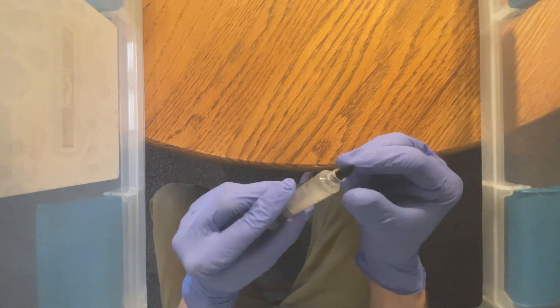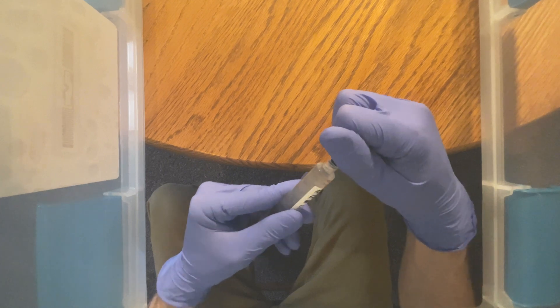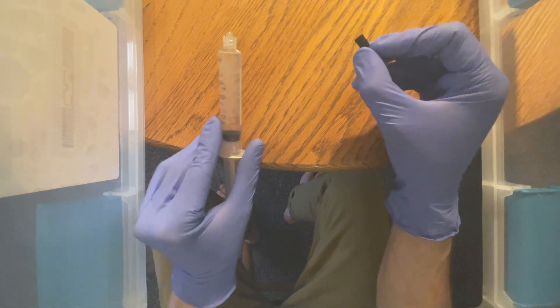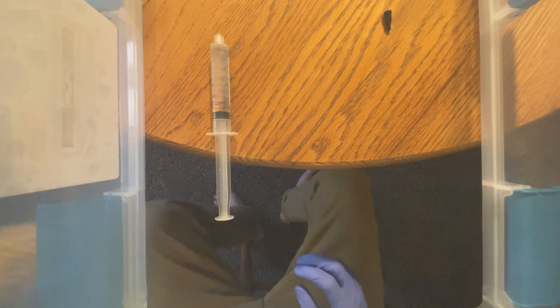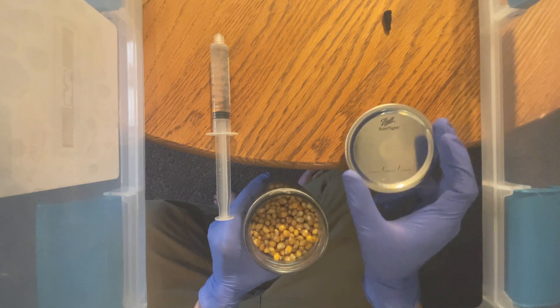This one is going to be more of a speed run. I am showing you all how that looks when I have a bunch of jars to knock up and really just not enough time. You usually don't want to rush through your inoculation, but I had an extremely busy night ahead of me. Since there's never not time for mycology work, I obviously pushed through.